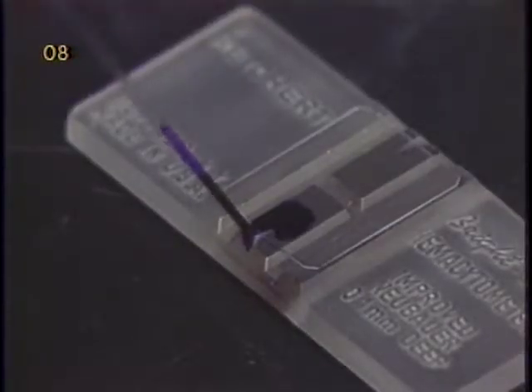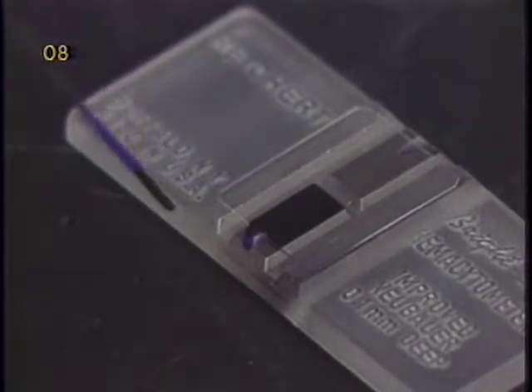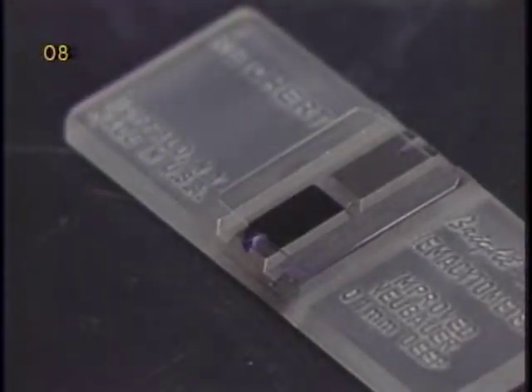Usually a drop of the suspension, including microcarrier beads and nuclei, is placed on the edge of the counting chamber. The clearance between the cover slide and the hemocytometer is relatively small and does not allow the microcarrier to pass through. Thus, nuclei migrate with liquid into the counting chamber while the microcarriers remain outside.